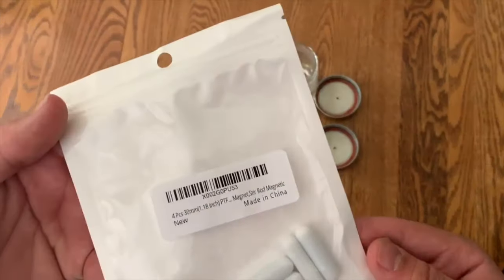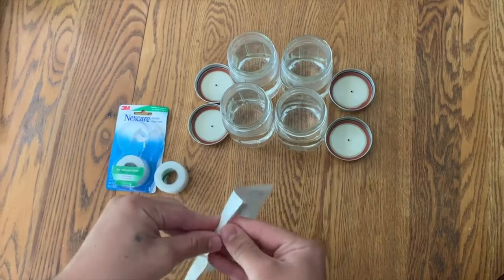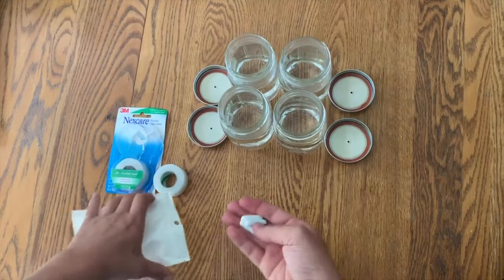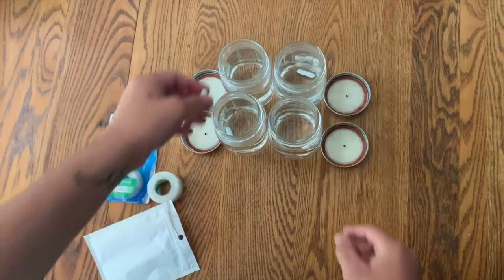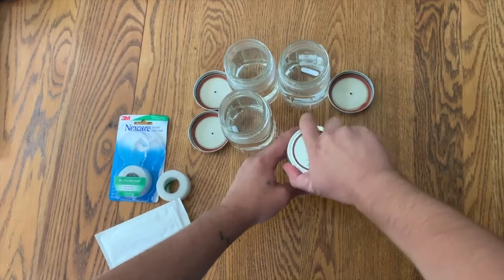The next step is adding your magnetic stir bar into the jar. If you don't have a magnetic stirrer you can use a marble. This is going to help disperse and break up the mycelium when it forms a dense cloud after growing for a while inside the jar.